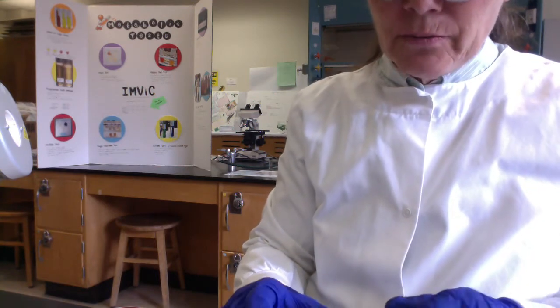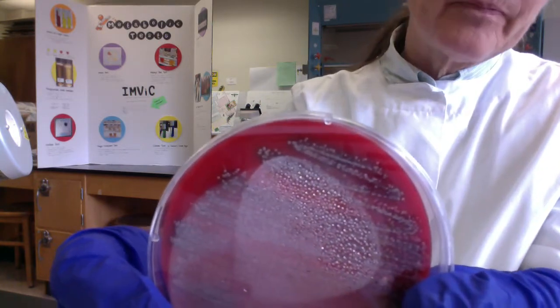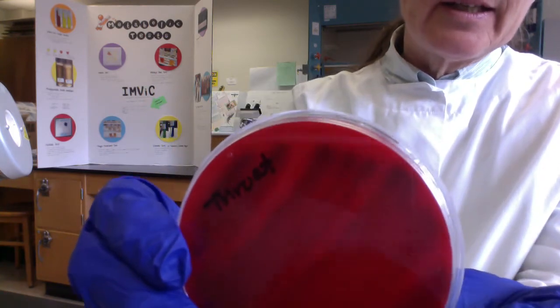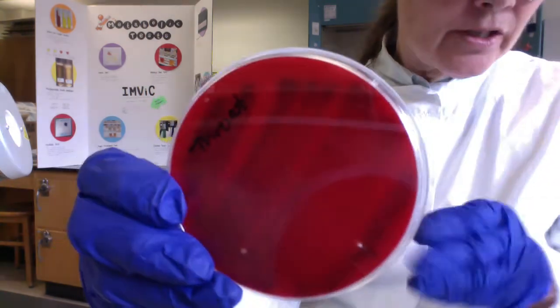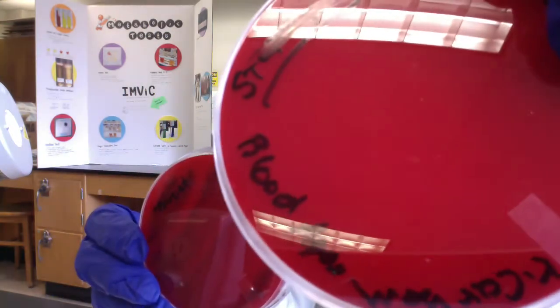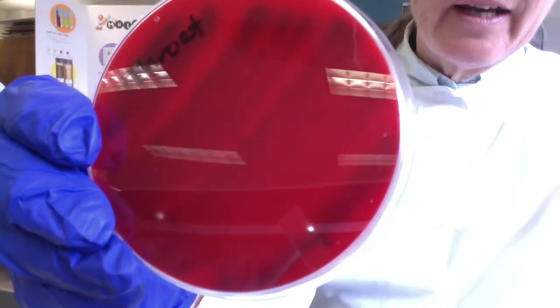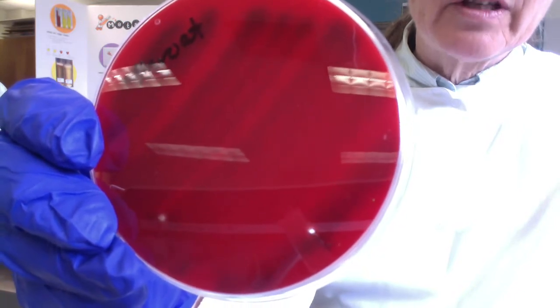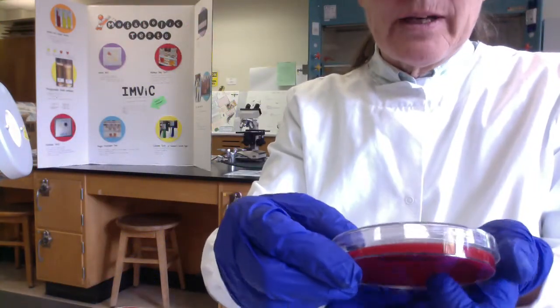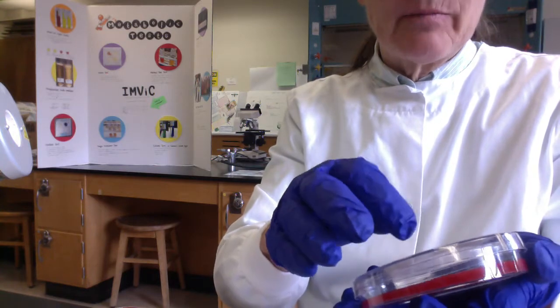So then, folks, this was a throat swab. I took a sterile cotton swab, and I tried to swab the back of my throat near my tonsils. And I know, again, it's kind of hard to see, but see that greenish discoloration compared to our uninoculated plate here? Okay, that greenish discoloration, that is called alpha hemolysis. And that's classic for members of your oral microbiome, such as Streptococcus mutans, the guys that form biofilms and plaque on your teeth, and then can cause an increase in dental caries and periodontal disease.